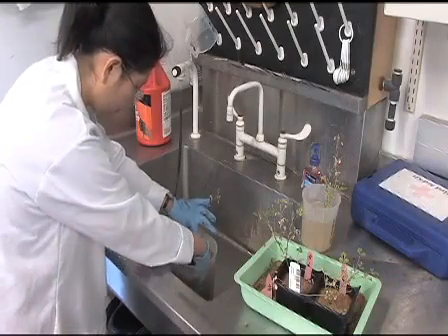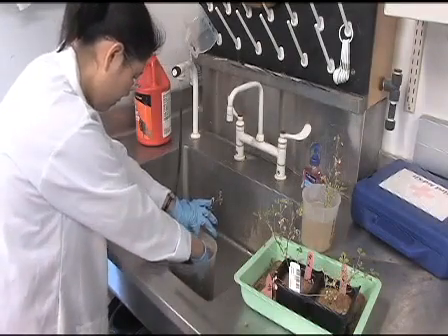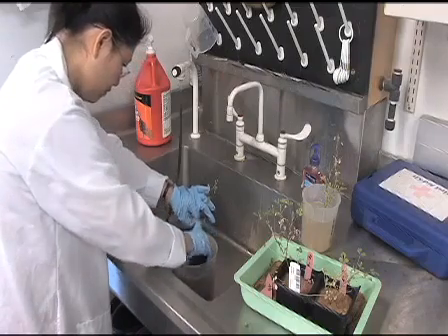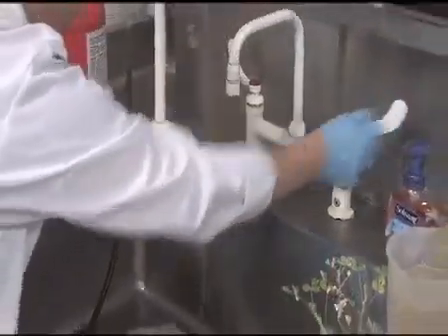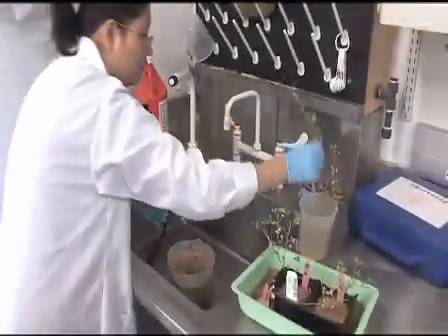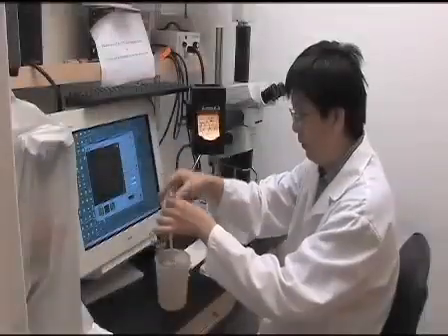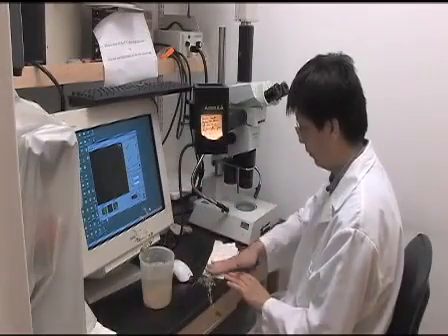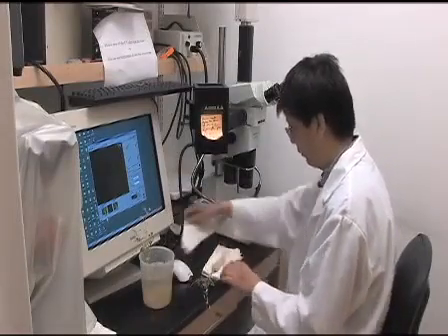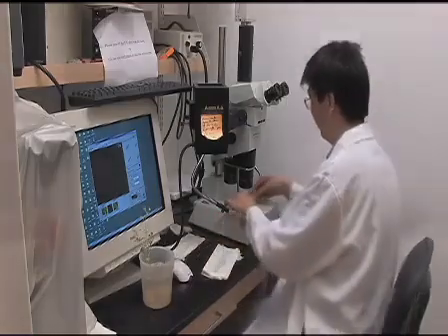Remove sand from the composite plants by uprooting and washing them. Use green fluorescent protein expression to check the transgenic root. You will use a fluorescent microscope to do this. All our hairy root constructs have a constitutive GFP cassette for screening transgenic lines.